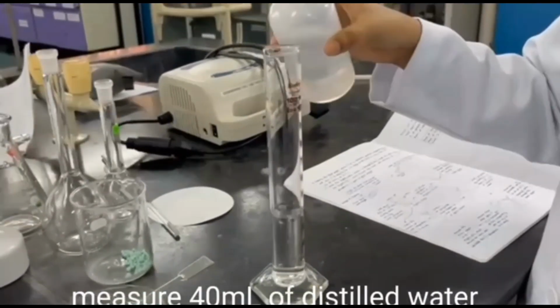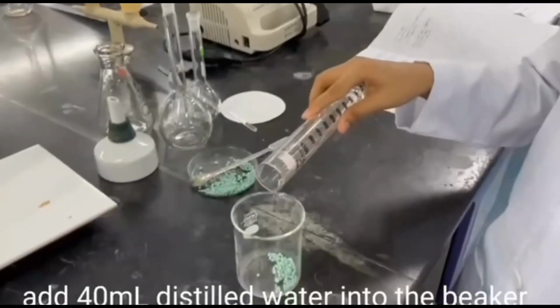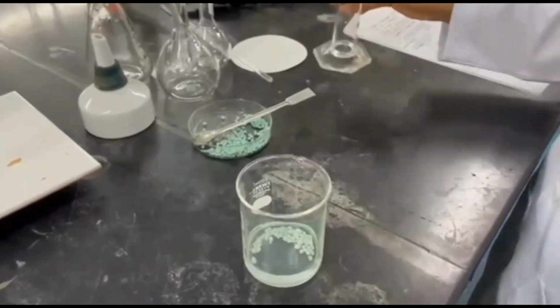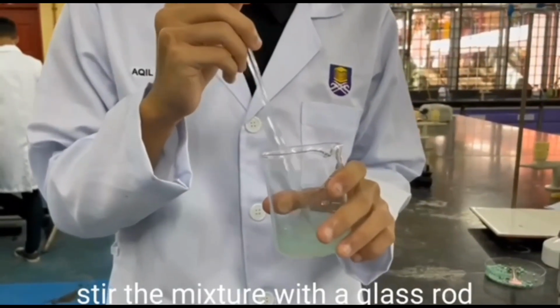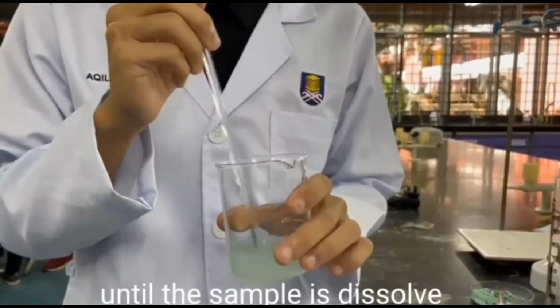Measure 40 ml of distilled water. Add 40 ml distilled water into the beaker. Stir the mixture with a glass rod until the sample is dissolved.